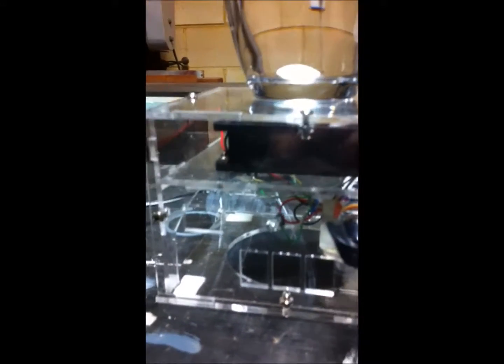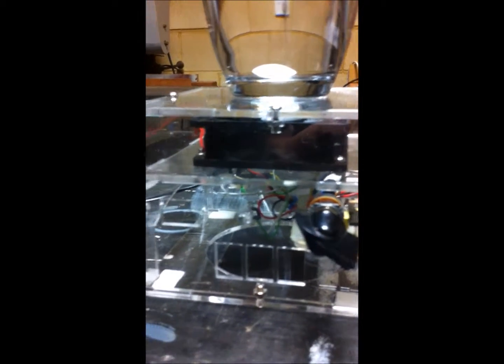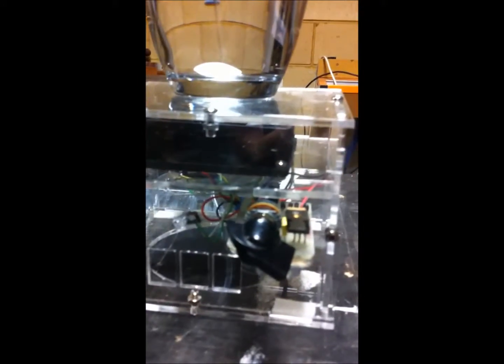For our effort, we're going to probably want to modify these to some switch holders that we can get in Australia. You'll notice that we've got an LED. This is a different part. This is a control for a pulse width modulator using a simple MOSFET and a 555 timer, that big blobby black thing in there, and a computer fan. And the computer fan has epoxied to it some neodymium magnets, which are just here.